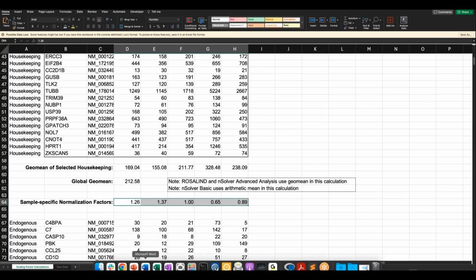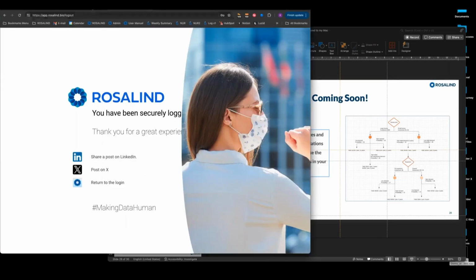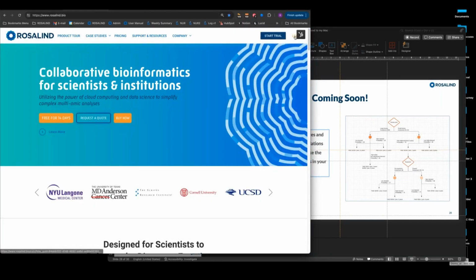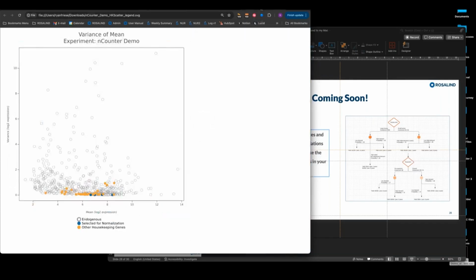So let's do a quick review in Rosalind, and then I'll answer some questions. I got logged out here. Let me log back in, and I'll show you what the QC looks like in the platform.